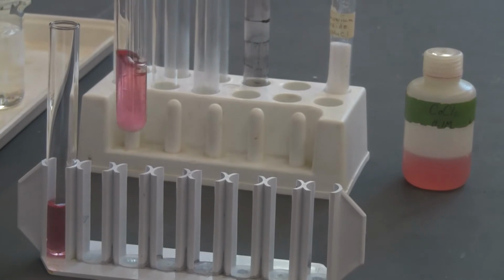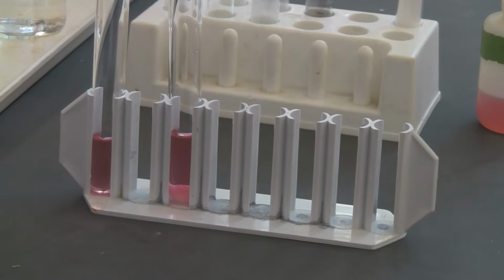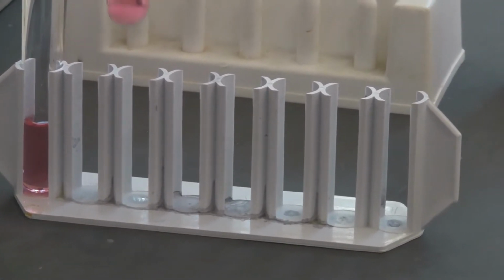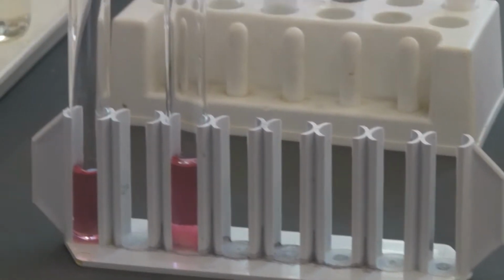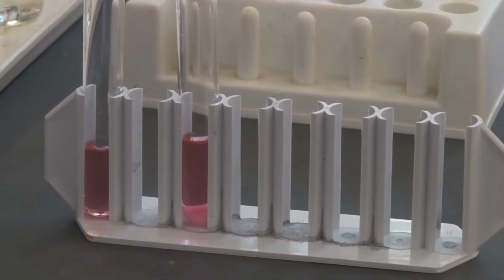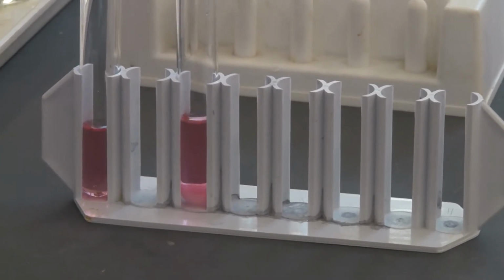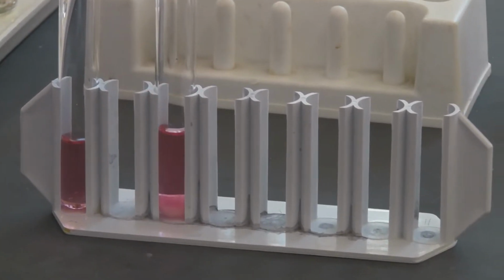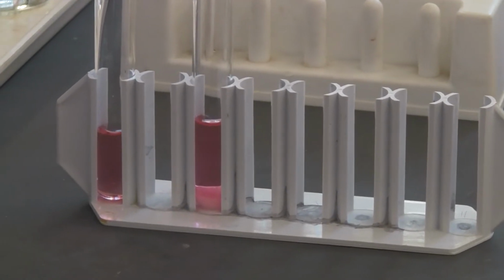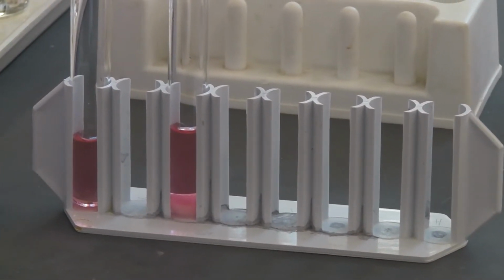So you have the equilibrium set up now. Actually, both have some equilibrium. This one you could add the ammonium chloride, so you are introducing more of the chloride, and it's just to make the equilibrium a little further to the right side. You can see the color, not very obvious. The reaction is kind of slow, but we are going to have a better equilibrium when we have the chloride in there. And the first one here acts as a control, so you can see the color change by comparing to the original color.